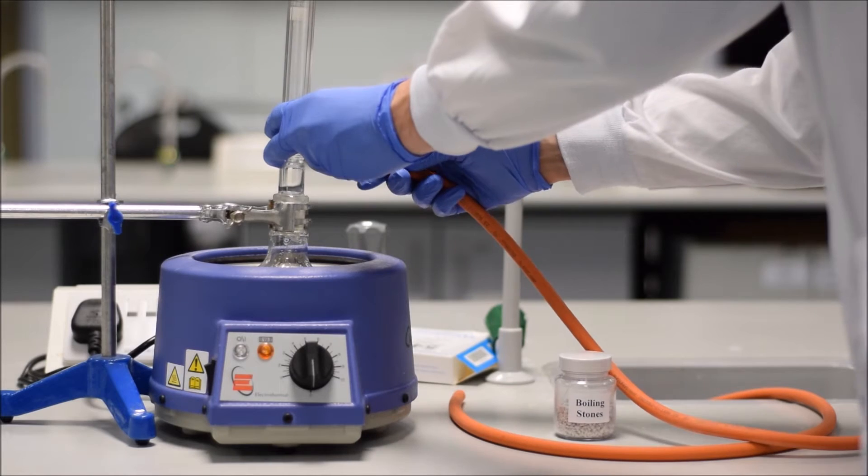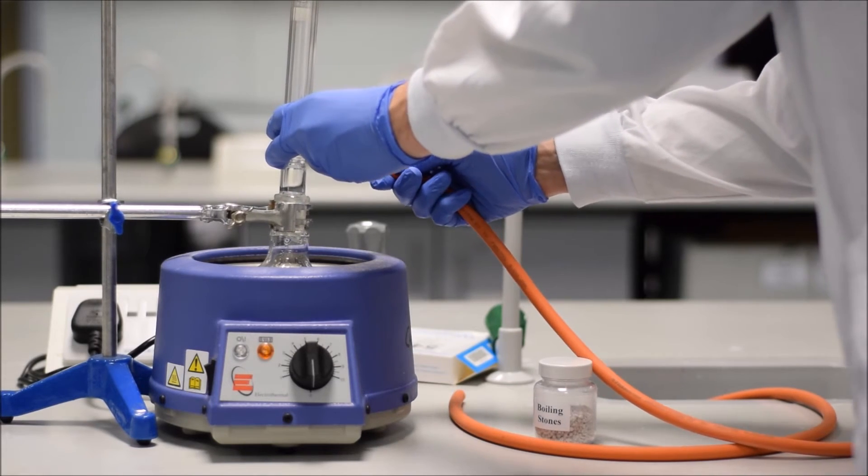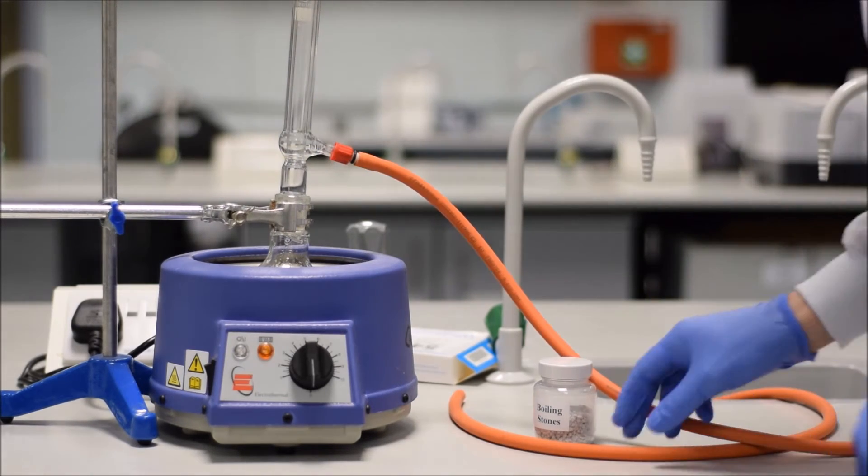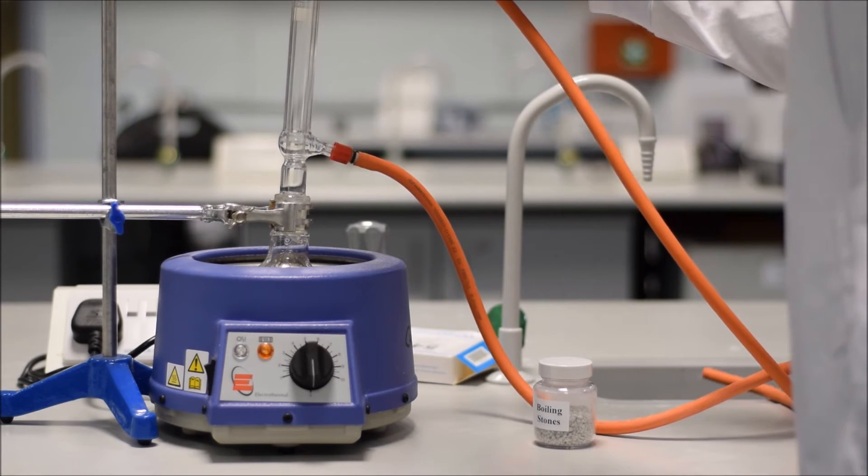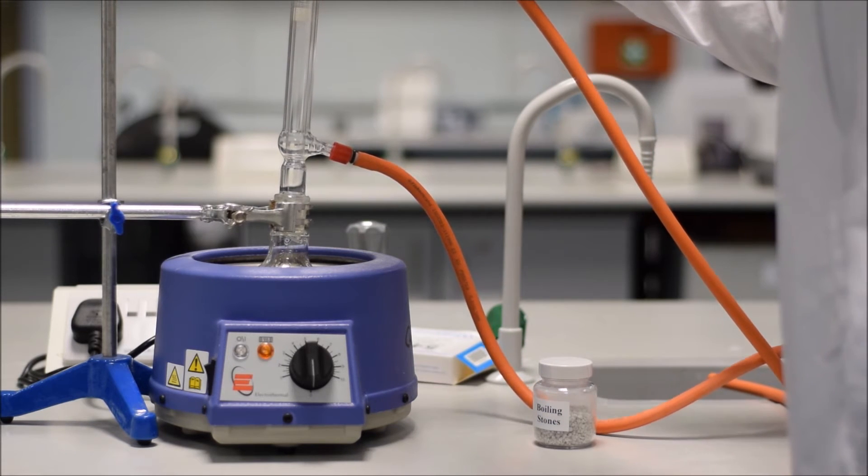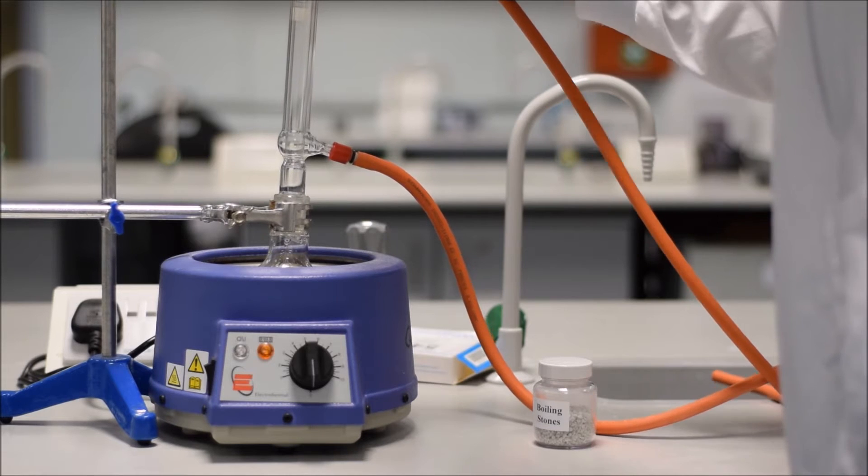Be sure to support the joints when you're attaching the tubing, because you don't want to place excess strain on your glassware. You don't want anything to crack. You don't want anything to break. So attach your glassware, and now let's flow some water through.